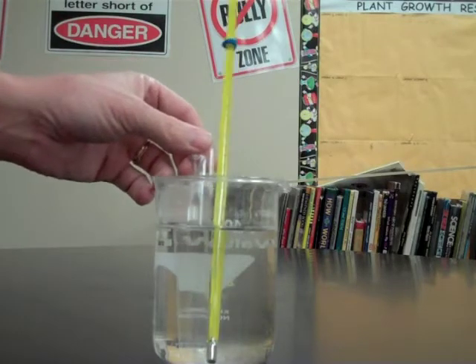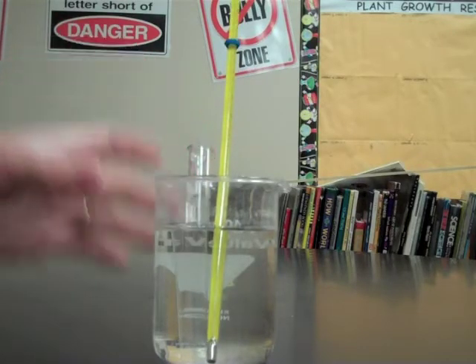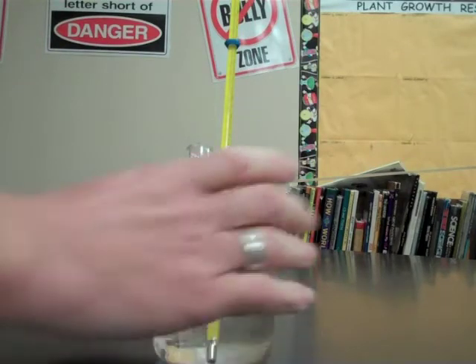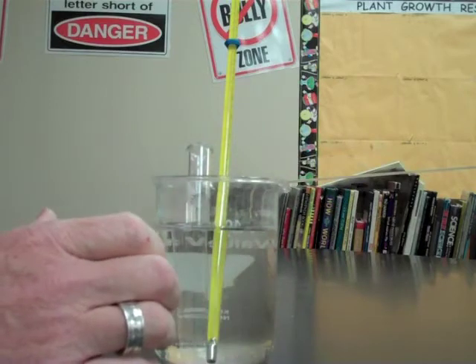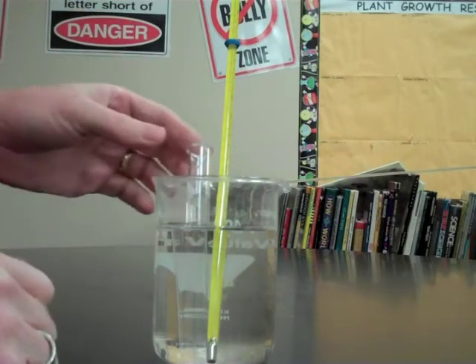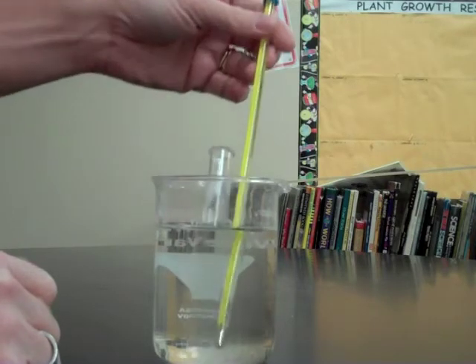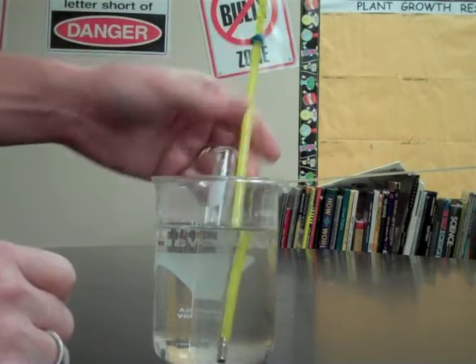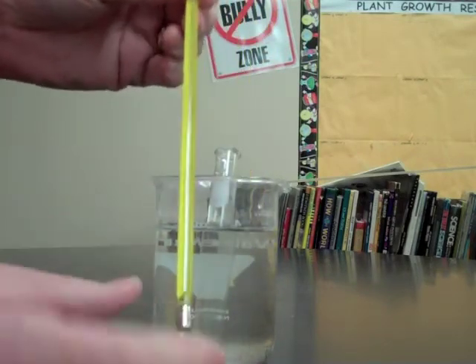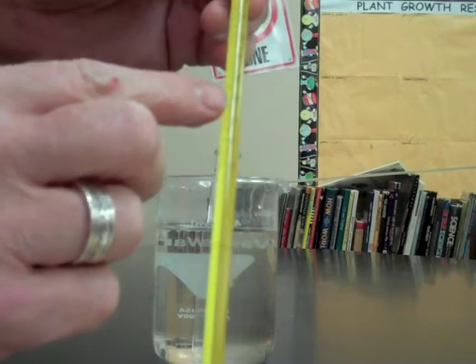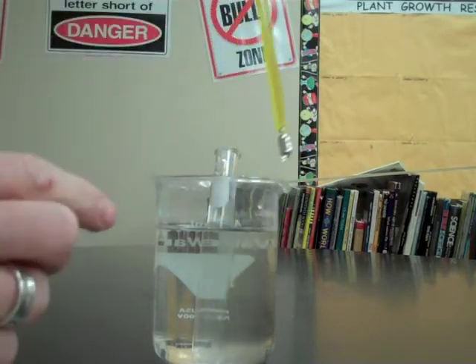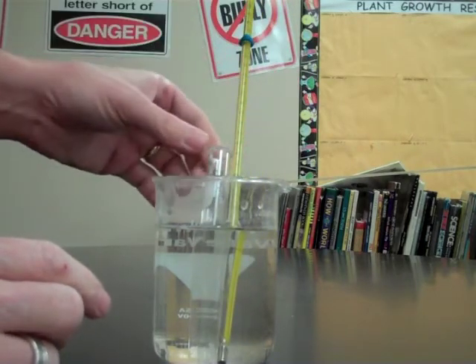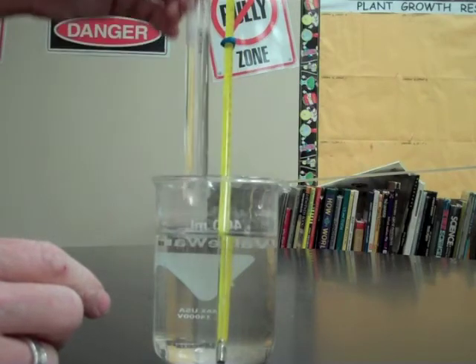What I have here is a test tube that was sitting in an ice bath. Basically this beaker with water in it was sitting in a container with ice wrapped all around it to cool it down. I have a thermometer in the water that was cooling down the test tube. The temperature is right at 20 degrees, which is right about room temperature. This has been sitting here for over an hour, so the contents of the test tube is also that same temperature.